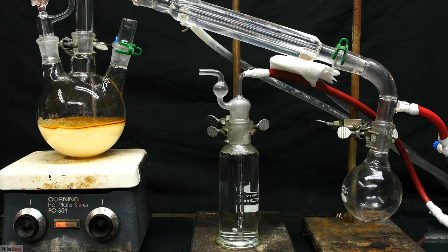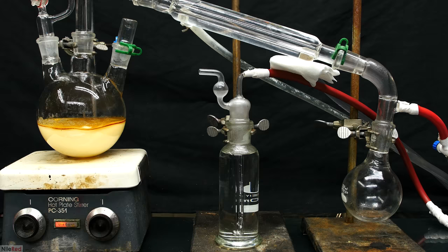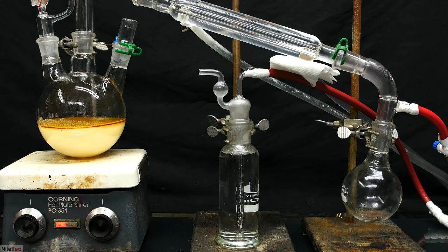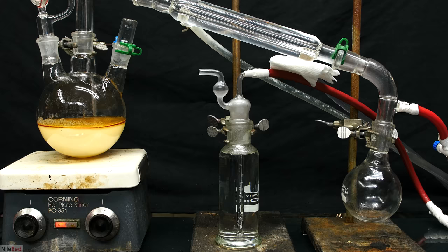At this point, it's extremely important to realize that since no more sodium hydroxide is being added, the contents of the reaction flask will start to cool. The air in the apparatus will cool down and shrink in volume, and it can create a suck back effect. This can cause the contents of the bubbler to be sucked back through the hosing and into the receiving flask. To prevent this, I separated the bubbler from the rest of the apparatus by closing the blue stopcock you see on the right.